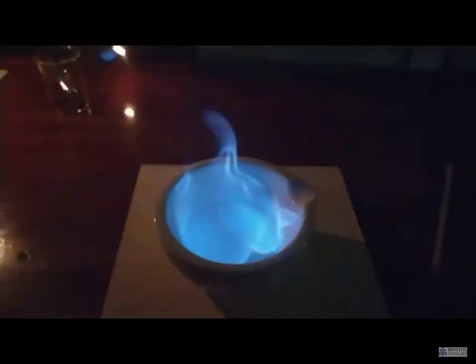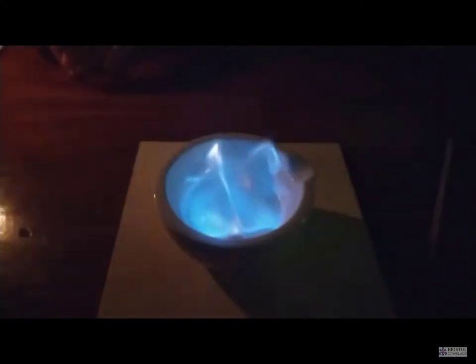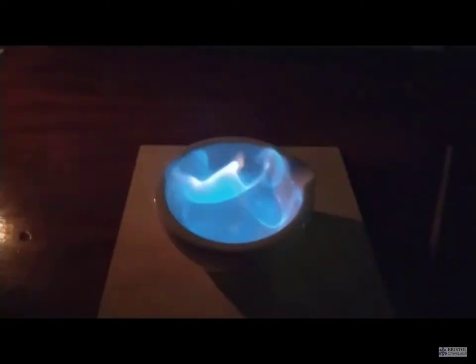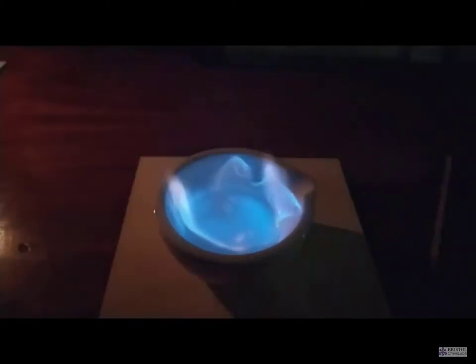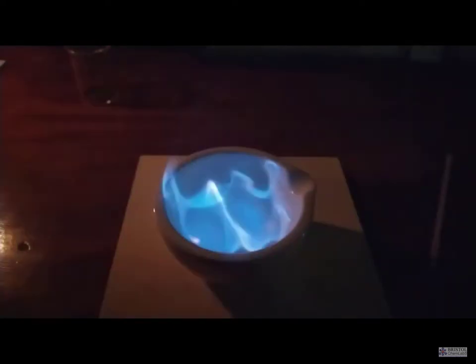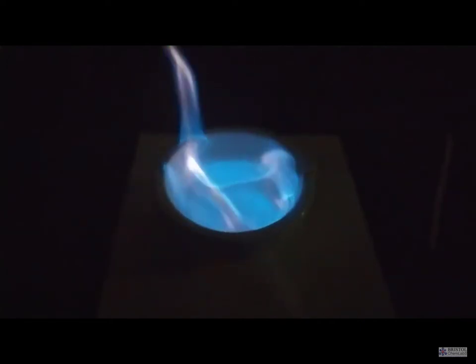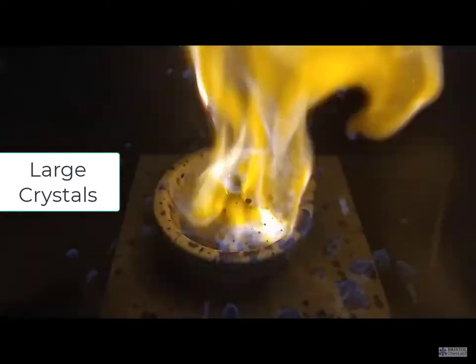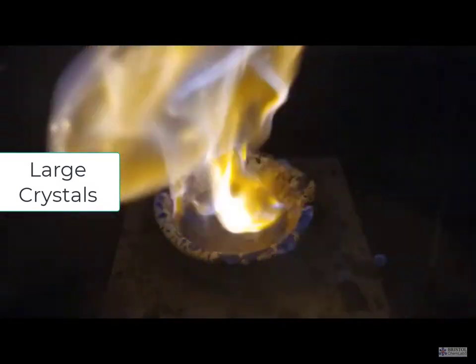To carry out the experiment, mix up the hydrogen peroxide and ethanol in the container. Set fire to the contents of the container, making sure other ethanol is well out of the way. Then put in — in one go — half a gram of larger crystals of potassium manganate 7 into the flames and stand back.